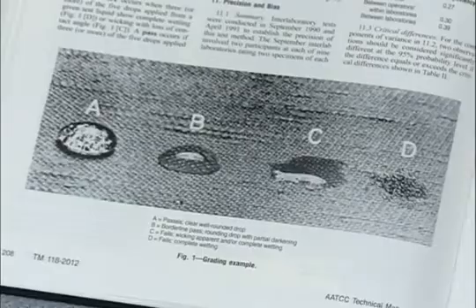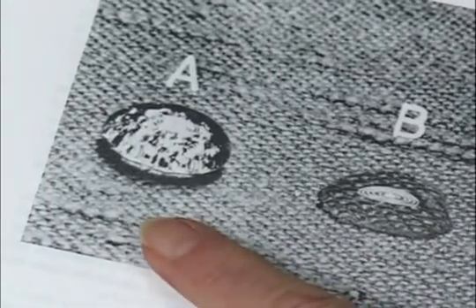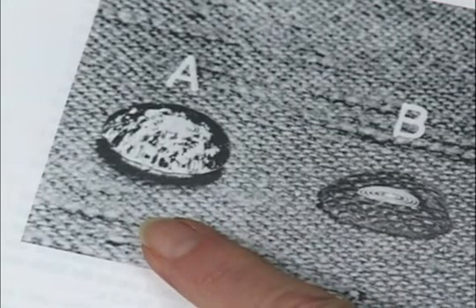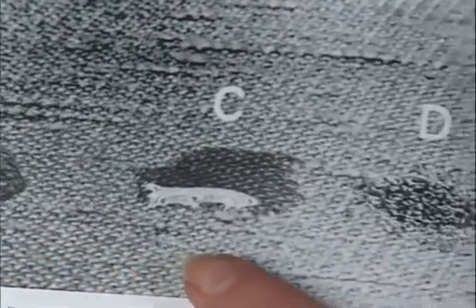Here's how the visual scale works. A means the fabric passes — there is a clear, well-rounded drop. B equals a borderline pass — there is a rounded drop with partial darkening. C means the fabric fails — wicking is apparent and/or there is complete wetting. D equals fails — there is complete wetting.